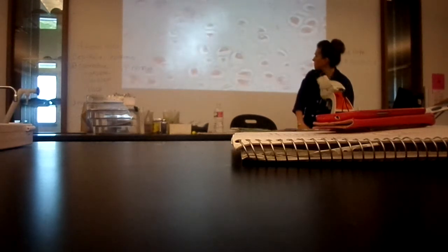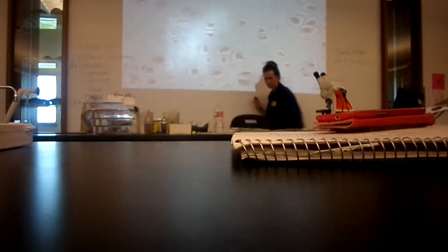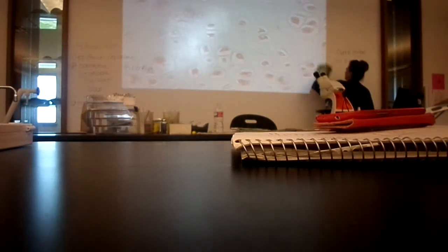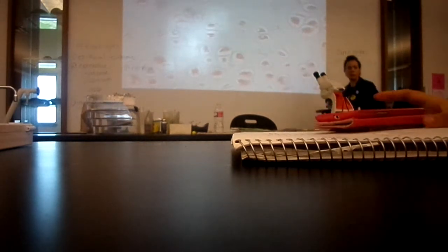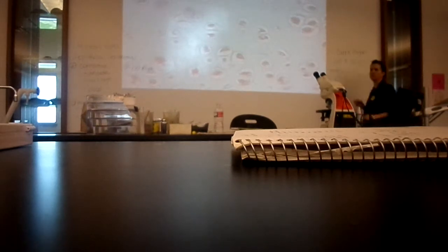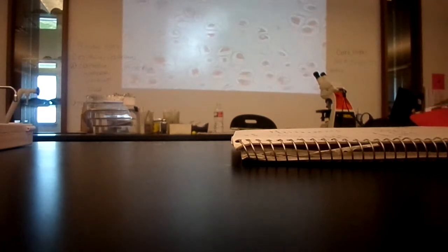And I want you to notice that we can see some cells, can't we? And then we can see some pale stuff in the back. The pale stuff in the back, that stuff is the matrix. Okay? The matrix is made out of different types of proteins. So the stuff that's here that's non-living, this is the matrix. The matrix is made of different things like collagen. In hyaline cartilage, you also have a compound called hyaluronic acid. It's non-living material. I don't care that you know exactly what it is.